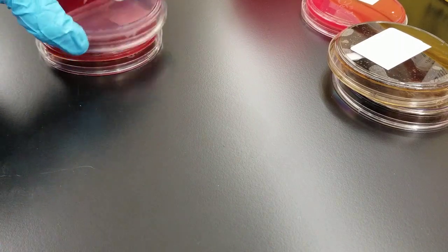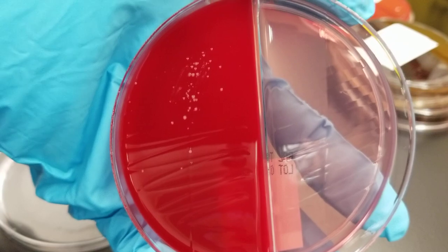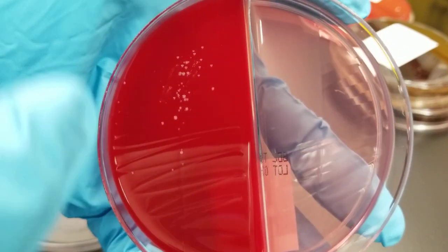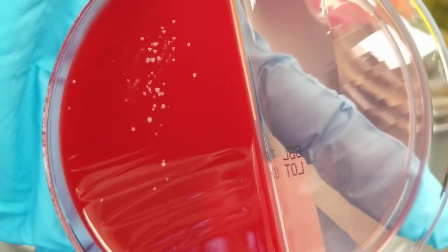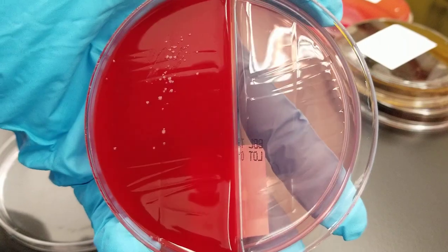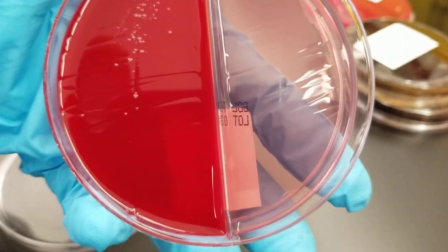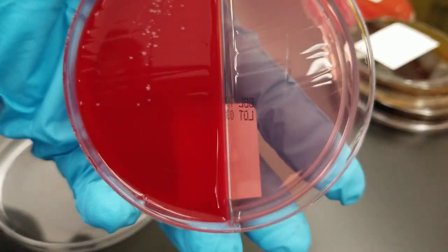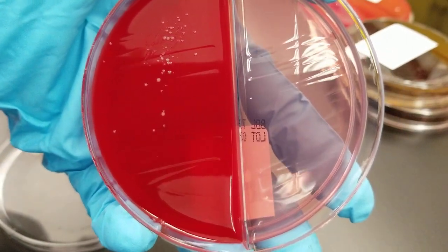Now I have some urine cultures that are not necessarily considered pathogenic. This one looks like normal flora — there's not a whole lot there. Notice there are different kinds of bacteria, about two different kinds, which is very indicative of normal flora as we just described. There's no growth here on the MacConkey agar plate. But that doesn't mean it can't be pathogenic if it doesn't grow there, because common pathogens that may not grow on MacConkey include Staphylococcus saprophyticus and Enterococcus.